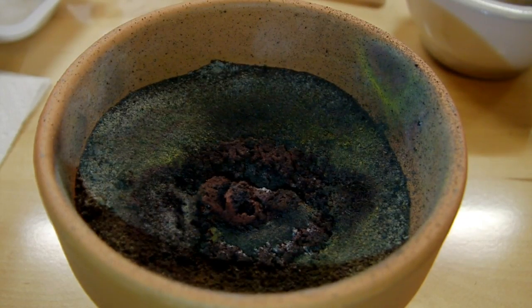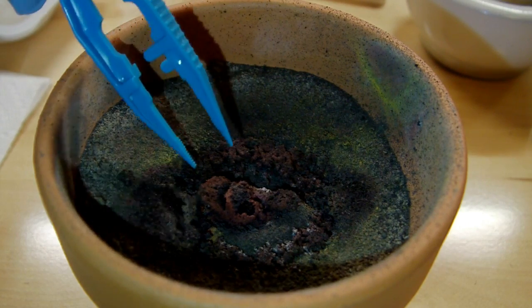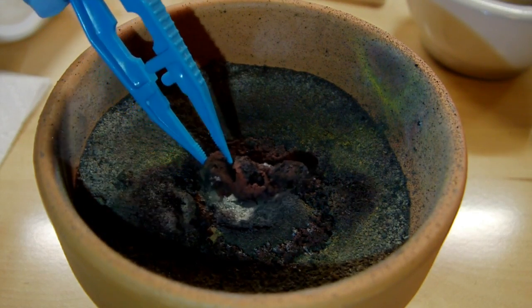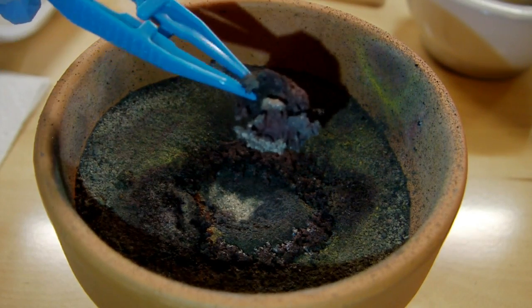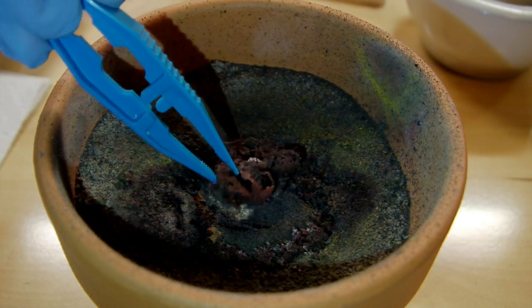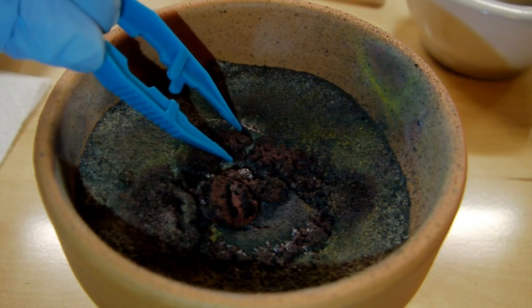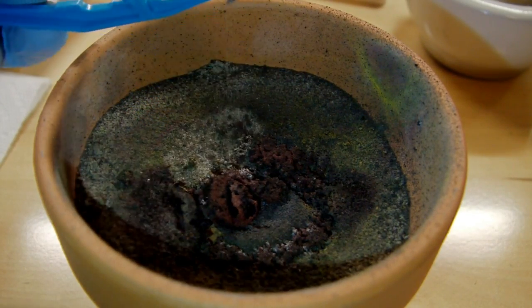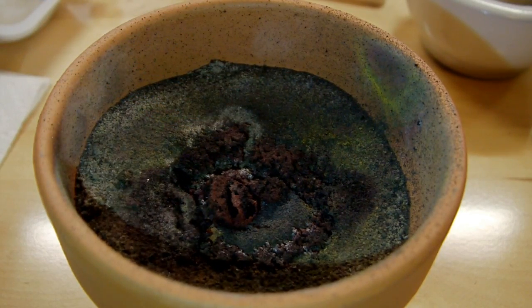Okay, here's the results of the thermite. It looks like it pretty much all reacted. You can see the reddish color, which is from elemental copper that was produced, I'm sure. This is the remnants of the permanganate glycerin portion of the reaction, and I imagine this red powder has got to be copper. Unfortunately, it doesn't look like it collected into a big lump like these usually do, but copper is a little more violent than some of the other ones, so it's probably a little too much to expect that.